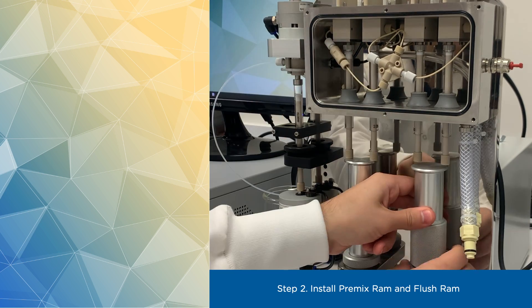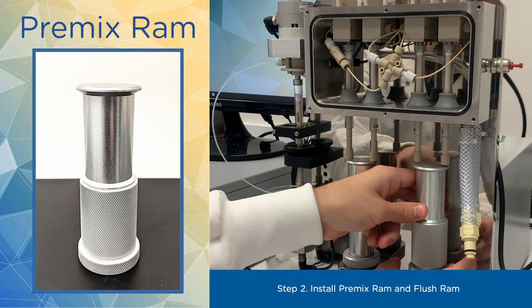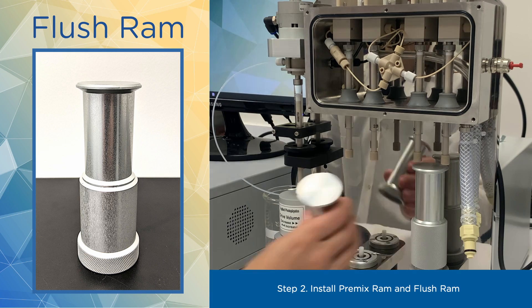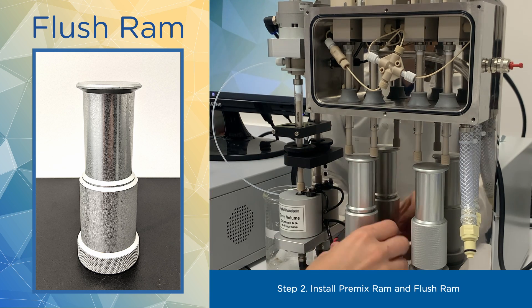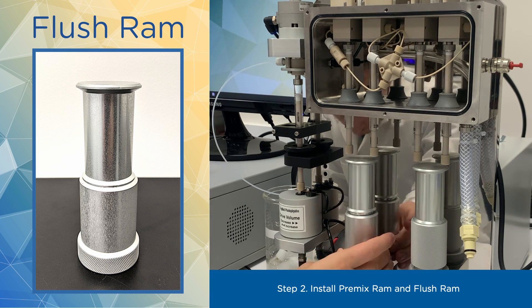Second, install premix ram on the right and replace the drive ram with a flush ram on the left. Both rams should be in a toolkit supplied with your instrument.